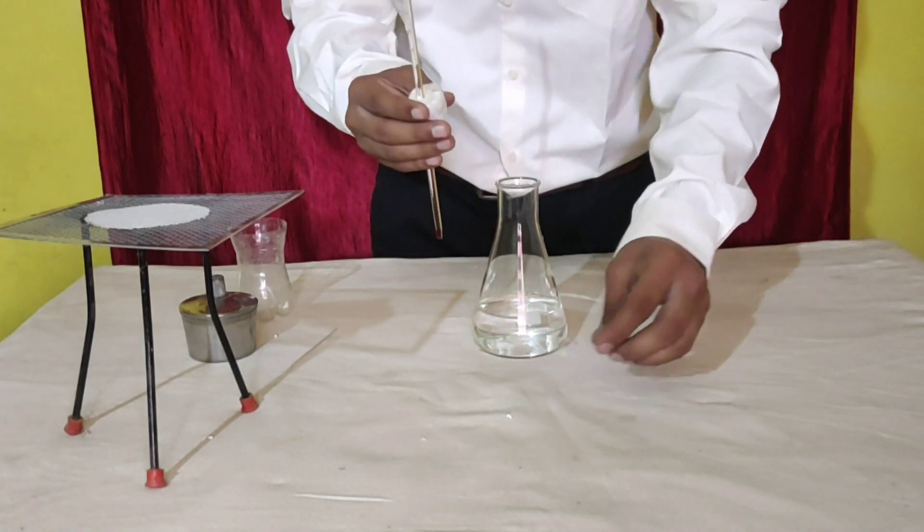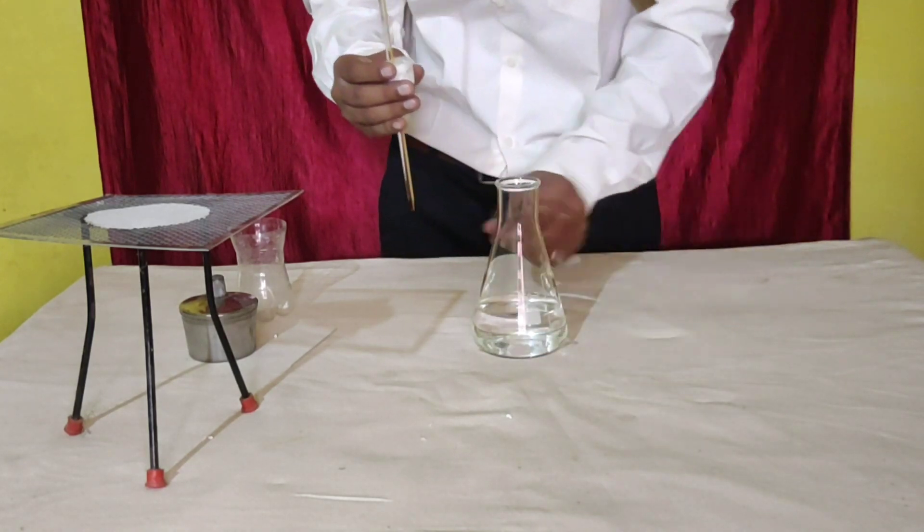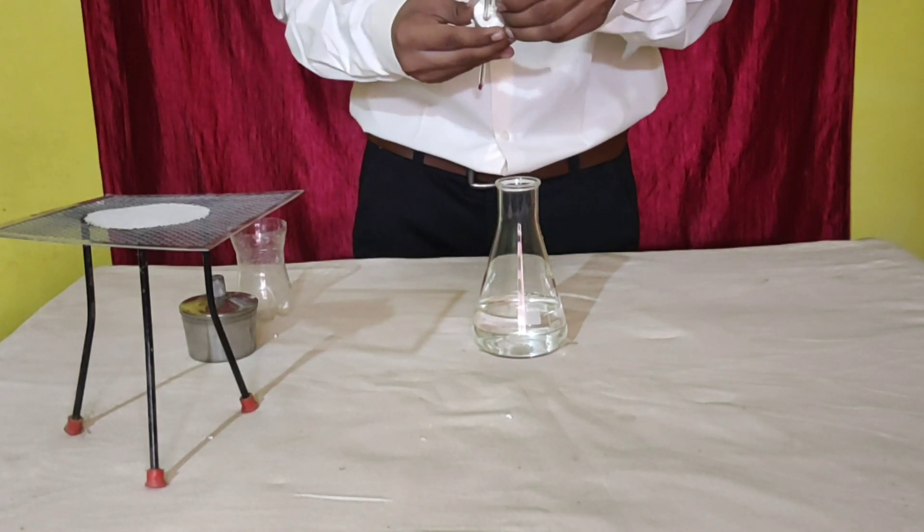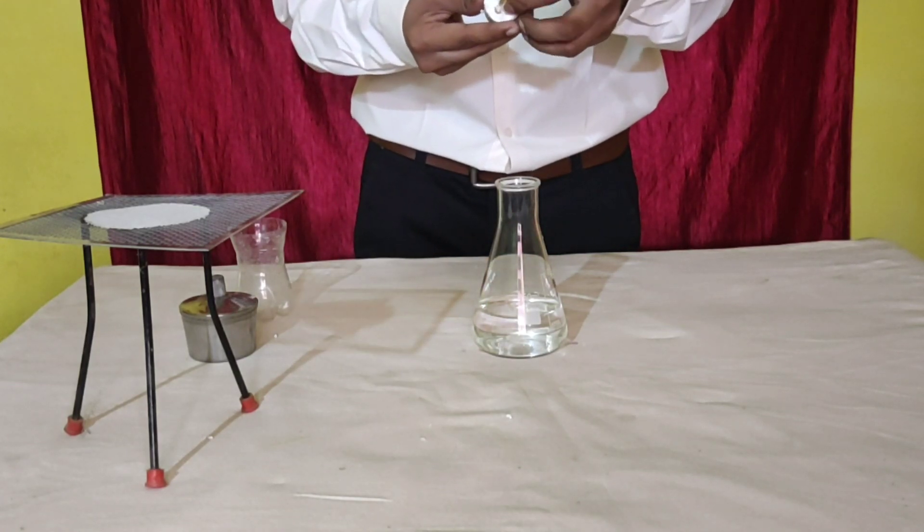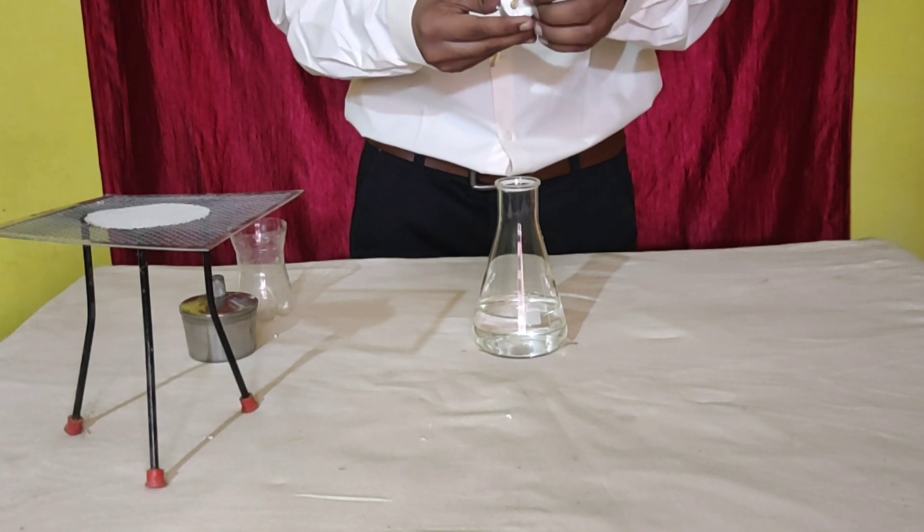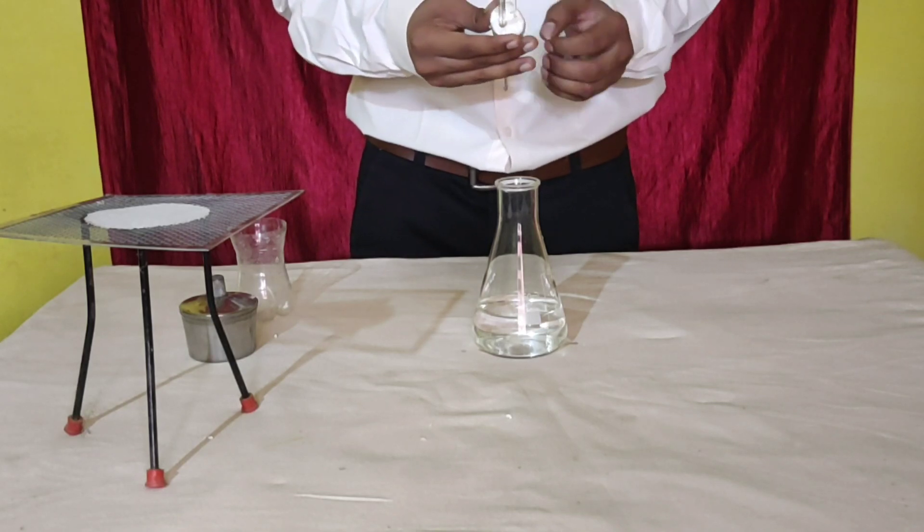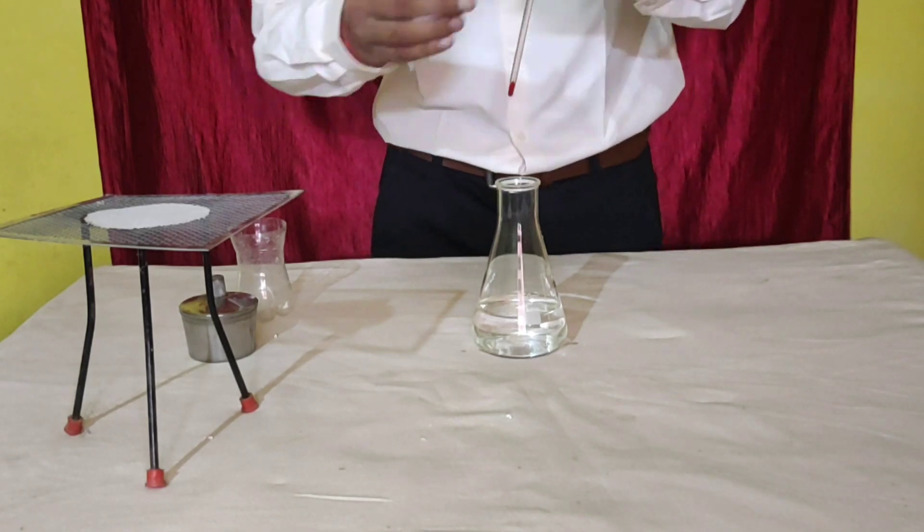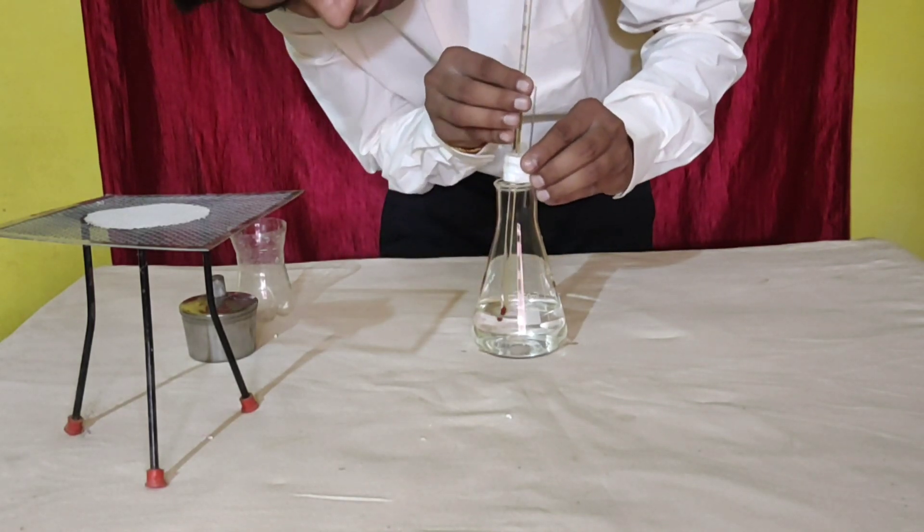And the glass tube through the other. Make sure that the thermometer hangs in the air, and not in touch with the water.